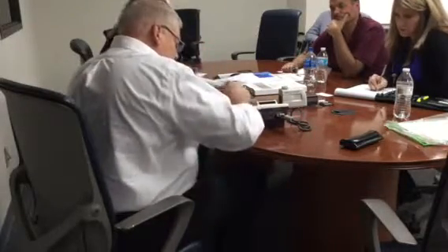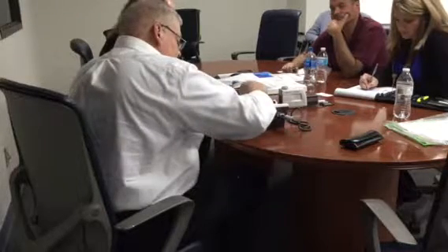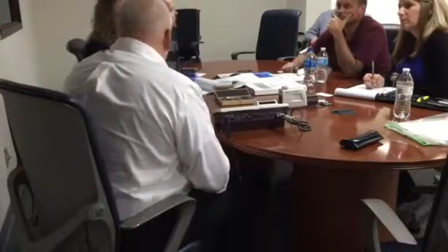Glasses for this. Working upside down. By the way, if this is the only patch you guys use, once he puts this in there, it's a sticky setting, meaning it won't change until somebody goes in and changes it. Oh, good. Or the battery dies. Oh, the battery does. That's okay. That's happened before.